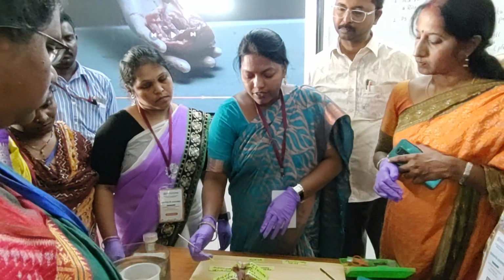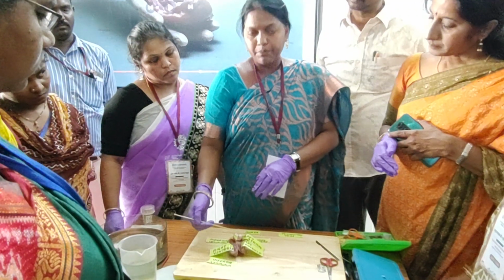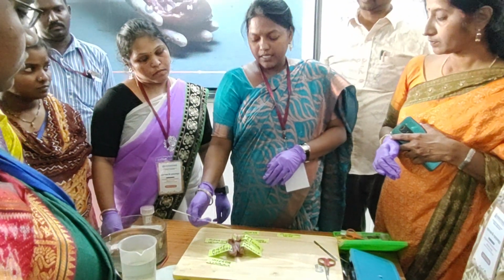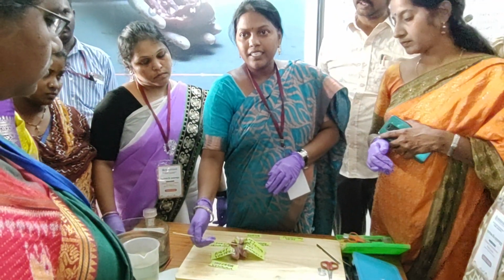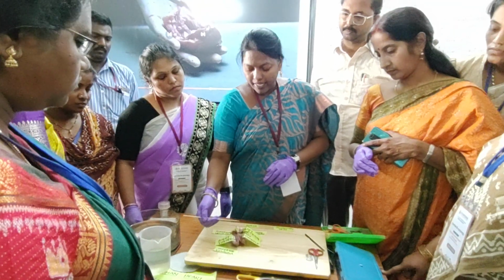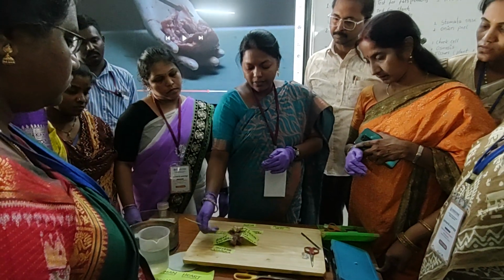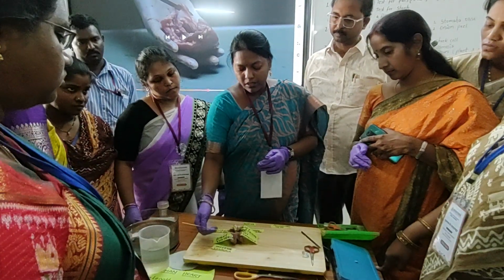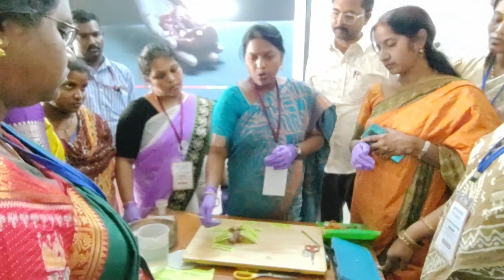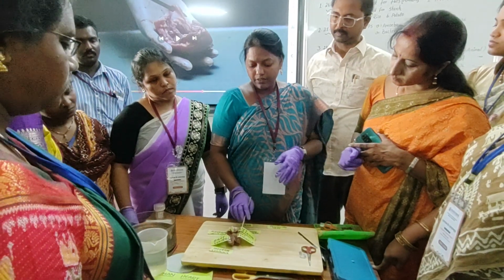Why are the lower chambers, the ventricles, thicker than the upper chambers? Because ventricular pressure developed is more than in the atria. Systolic pressure is more in the ventricles. They need to distribute oxygenated blood to all body parts, especially from the left ventricle.